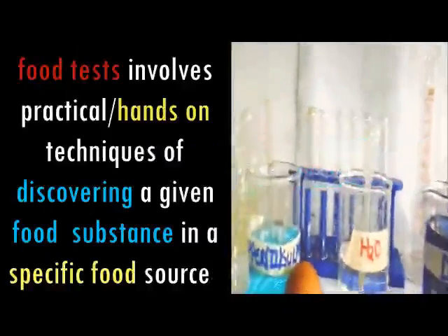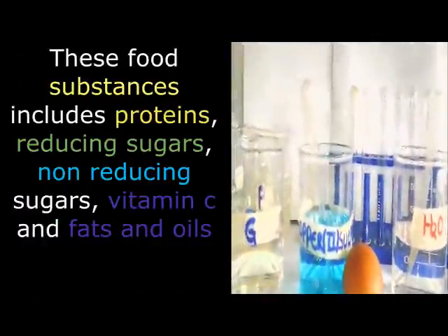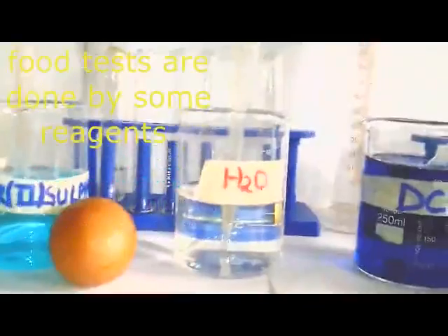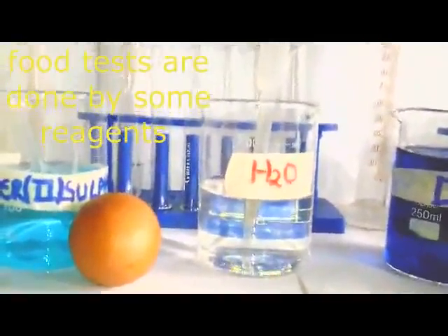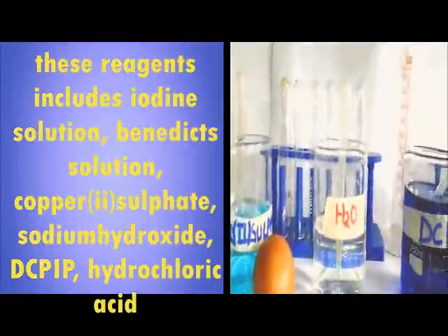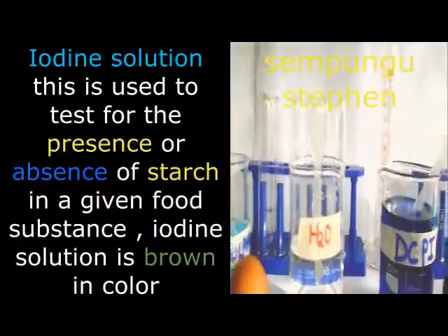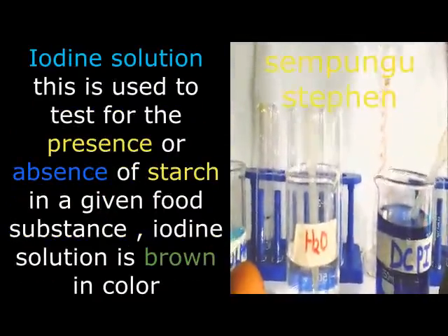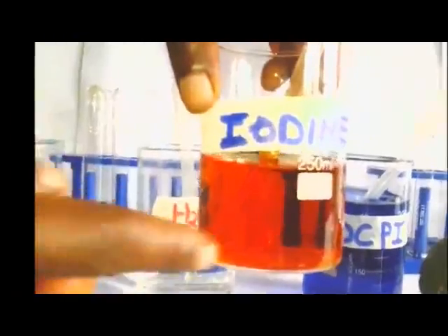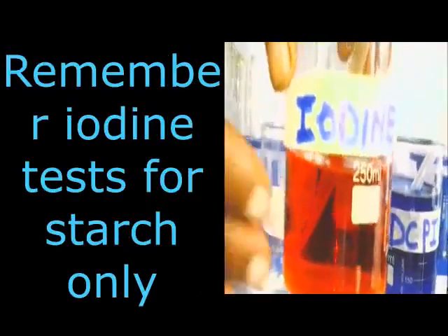Food tests: there are some components of food which we need to discover by investigating them practically. There are some specific reagents which we use when we are carrying out food tests, and I'm going to show you those reagents as we begin. One of the reagents we use is iodine. When you look at our iodine we can say it is brown in color, or we can say it is yellow. It depends on the concentration.